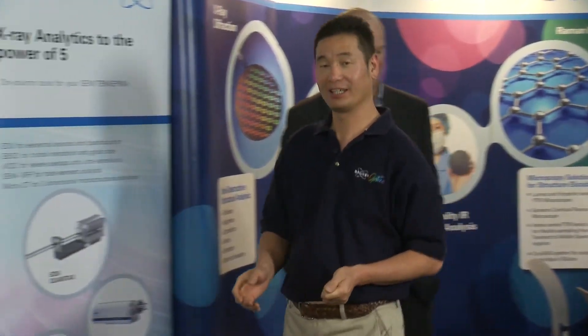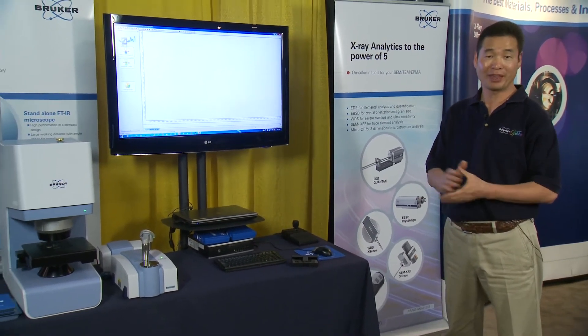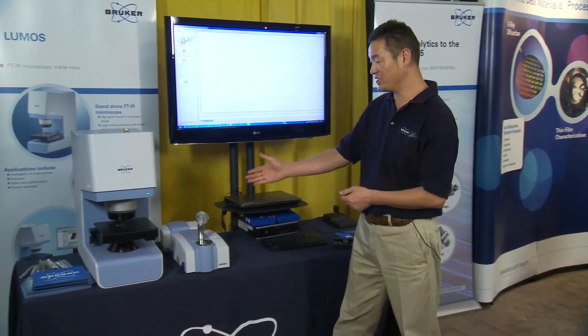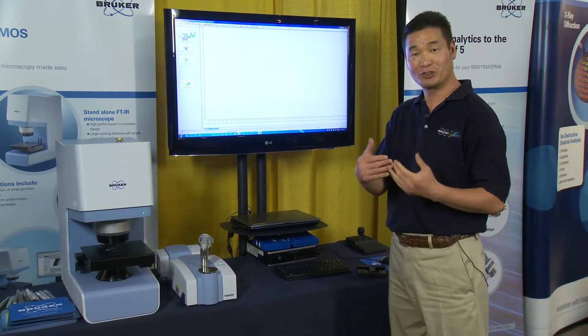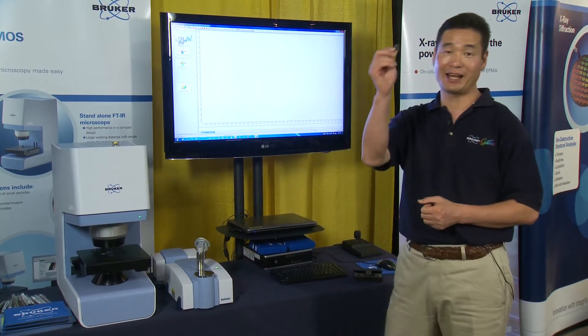Brian just talked about elemental analysis — metals, crystals, that sort of thing. But many failure or quality issues are caused by organics. What I'm going to talk about is the organics side: how organics can be detected by our easy-to-use FTIR system, microscope, or Raman system. So instead of just talking about it, I'm going to do a demonstration. Suppose I have a little material like this and I want to know what it's made of.